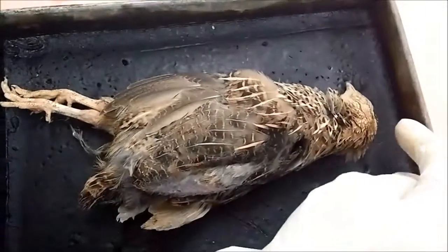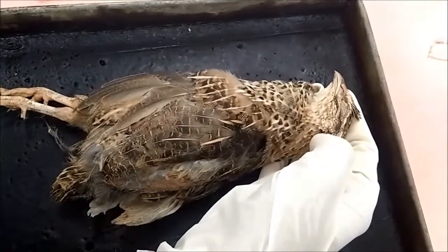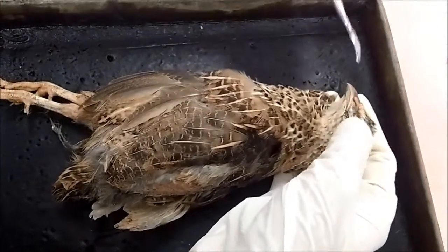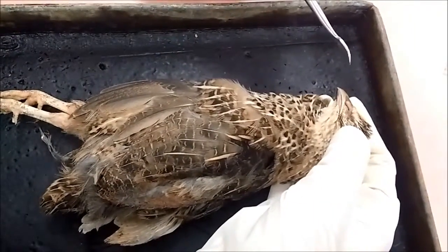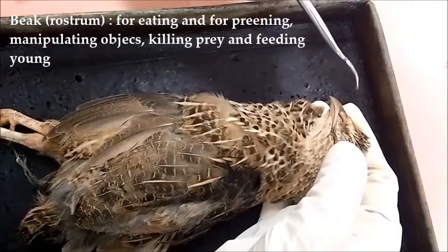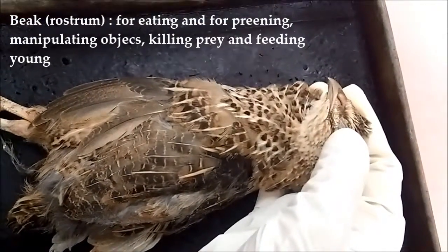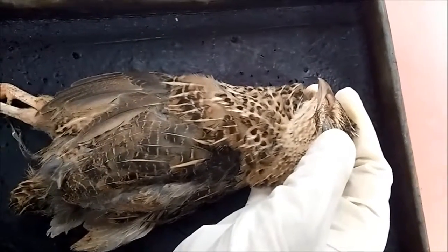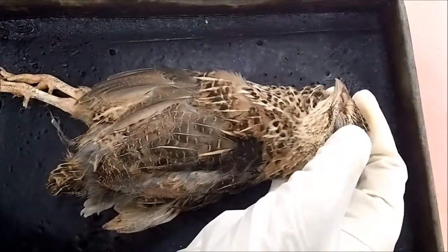So firstly, we are going to observe the head of the bird. At the head, it consists of the beak. This is the beak, which we also know as the rostrum. It consists of 2 parts: the upper beak, also known as the rostrum maxilla, and the lower beak. This is the upper beak, and this is the lower beak. Both are made up of a bony base and are covered by a horny sheath.